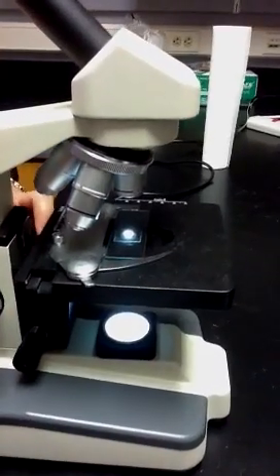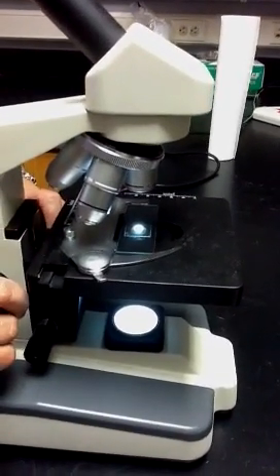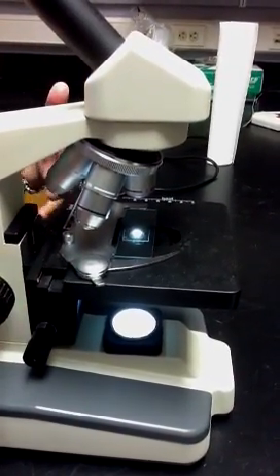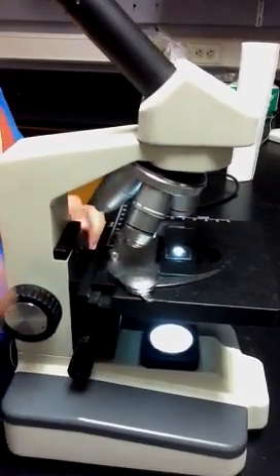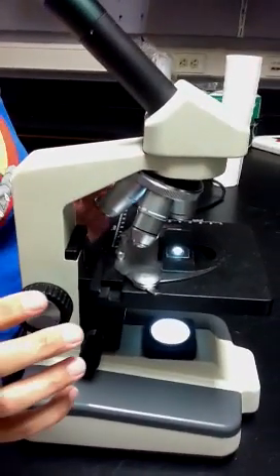Now here's the most important point. It's really easy. Students always have trouble using microscopes, but it's really very simple. I'm going to try to teach it to you in a couple basic steps.